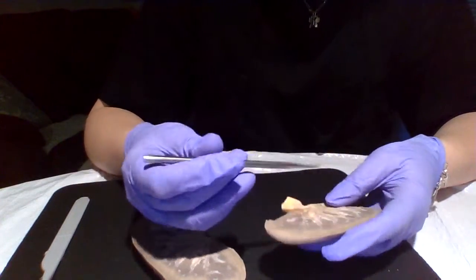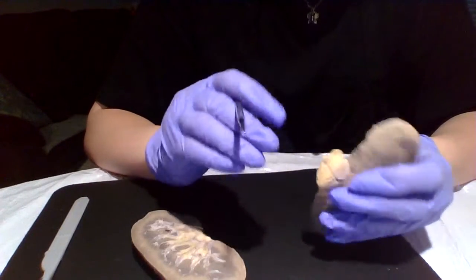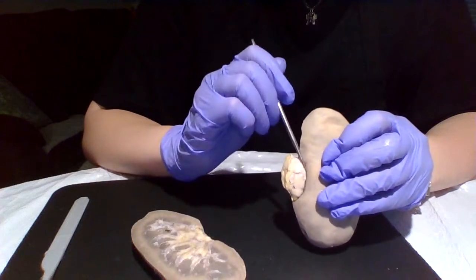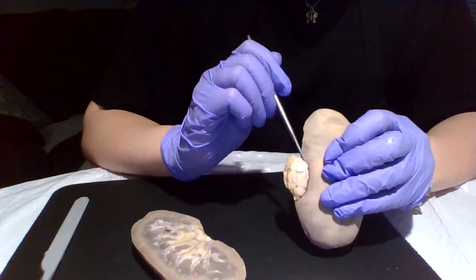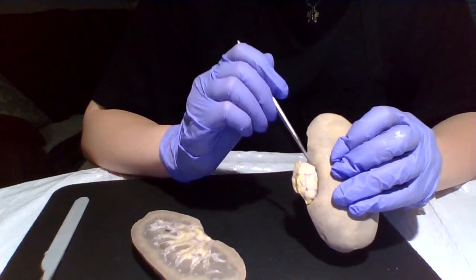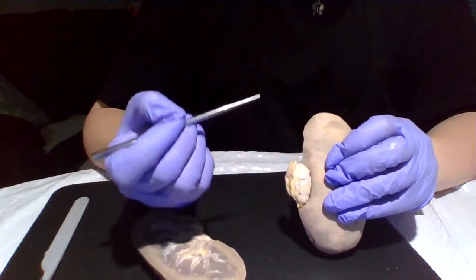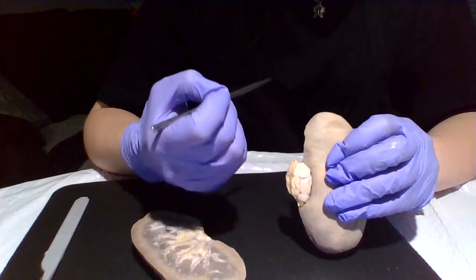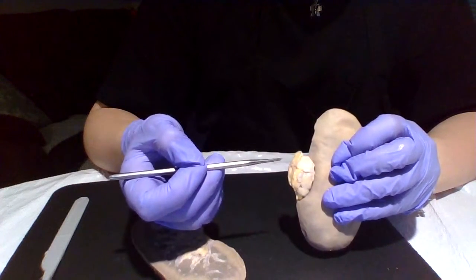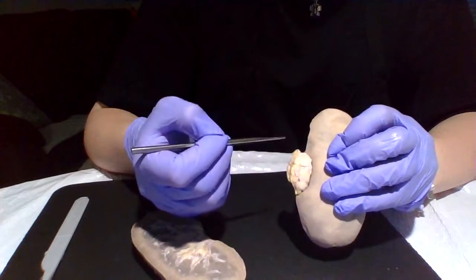Now moving on towards the outside, we're going to have the renal hilum, which is right towards the exit of the kidney. The renal hilum essentially is just that point of entry and exit for the renal arteries and veins, as well as lymphatic vessels, and also the upper extension of that ureter that I'm going to talk about.